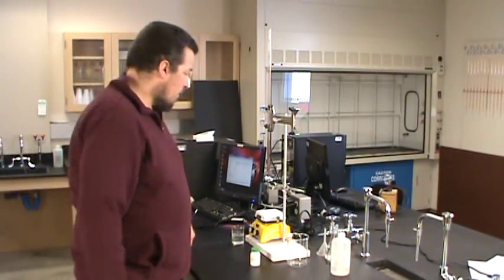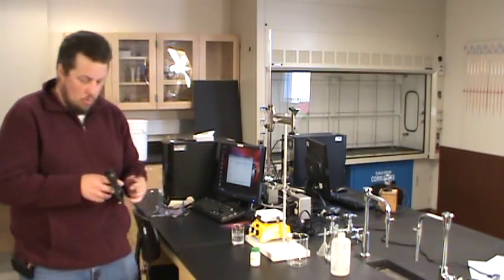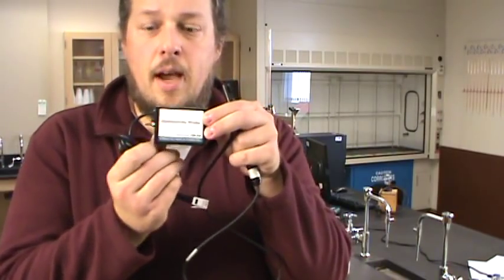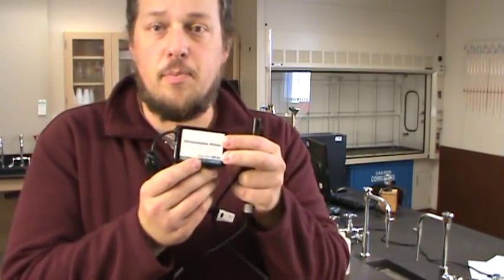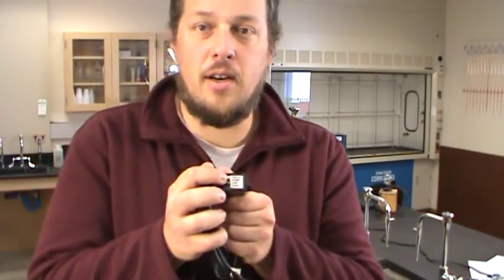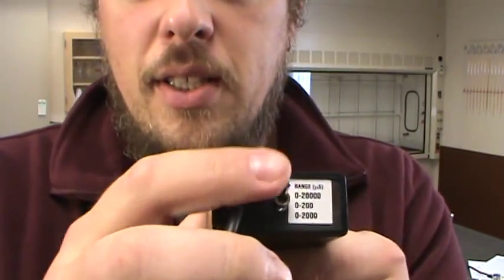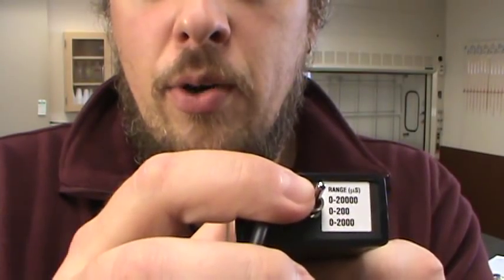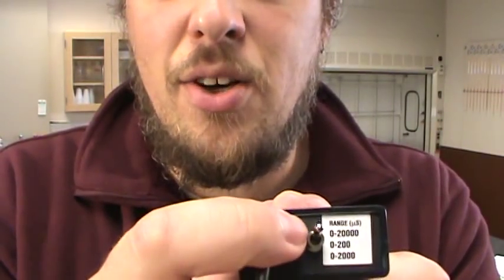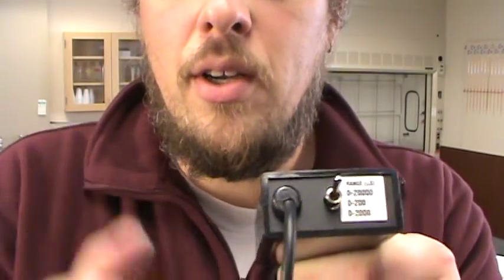Let's take a closer look at the conductivity probe. There's a little adapter box in the middle — this is one of the things mentioned in your lab procedure. In order for this experiment to work correctly, there's a selector switch here, and that switch has to be set to the proper range. You can have it set at 0–200, 0–2000, or 0–20,000. For our experiment, we should have it set at 0–20,000.